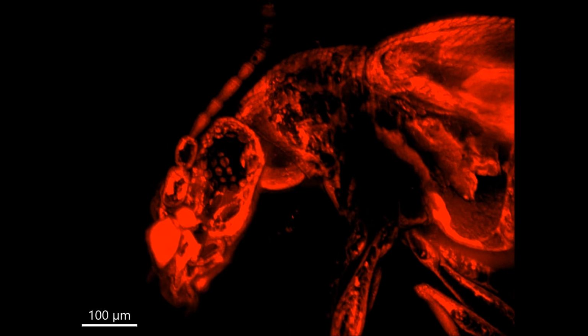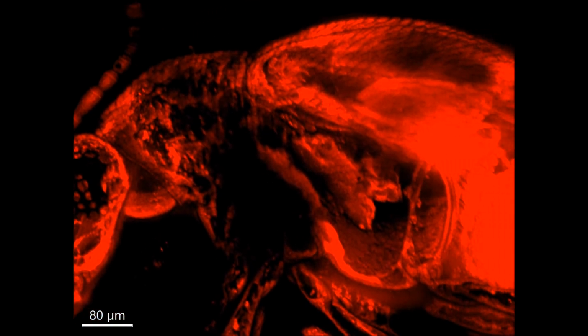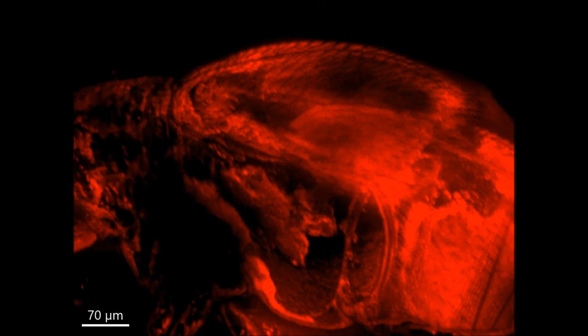It may also be a way to verify authenticity of the inclusions, because fluorescence of the biomolecules may help to distinguish between modern-day and fossilized remains. Depending on the condition of the specimen and wavelength, you can sometimes see the internal structures as well.